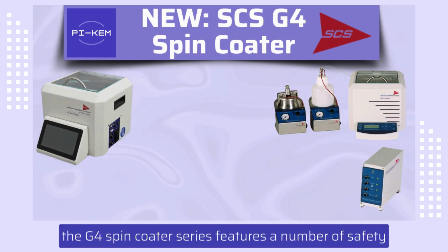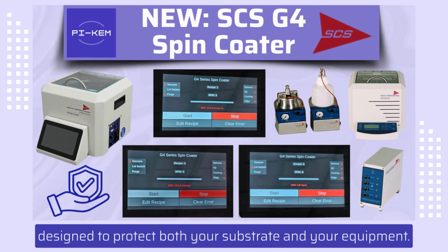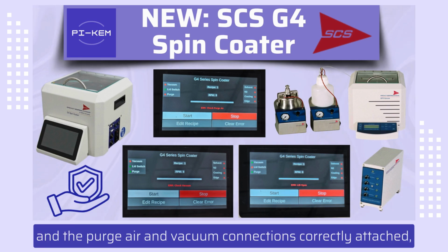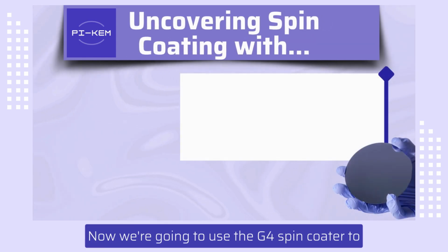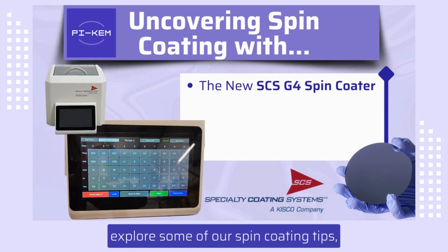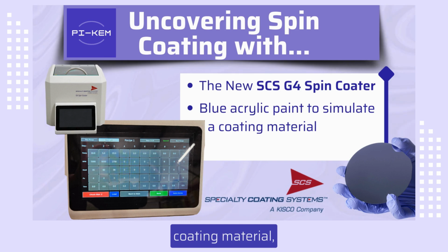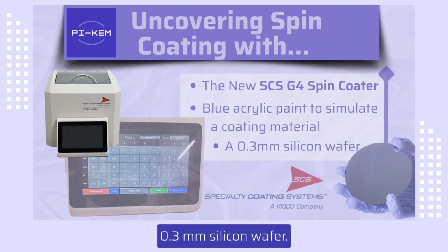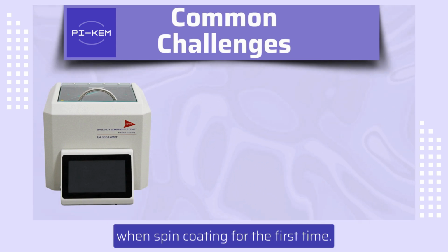Finally, the G4 Spin Coater series features a number of safety features designed to protect both your substrate and your equipment. These features ensure that the lid is firmly closed and the purge air and vacuum connections correctly attached before the coater will operate. Now we're going to use the G4 Spin Coater to explore some of our spin coating tips, using a blue acrylic paint to simulate a coating material, and coating on top of a 0.3mm silicon wafer.